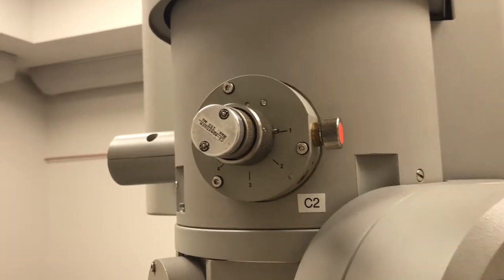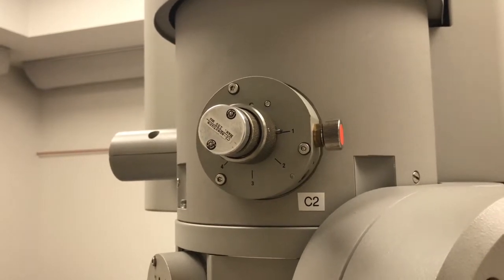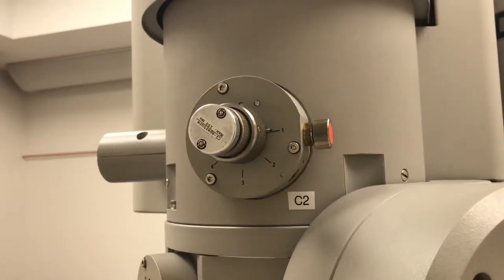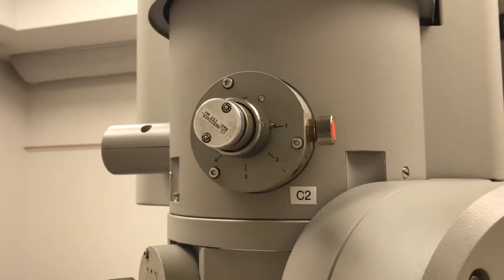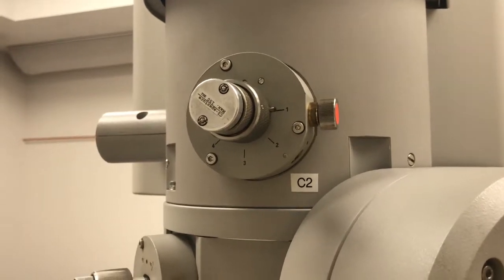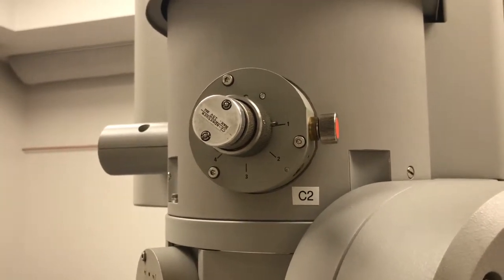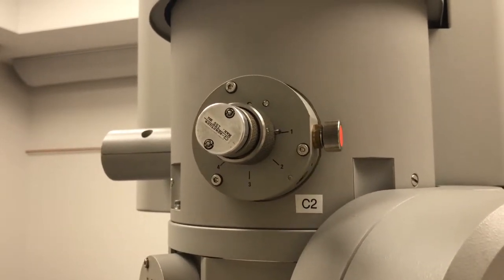I can still get reasonably high current using that aperture without the expense of a larger probe, so I'm leaving it set at one. I could boost it to two if I wanted and get an increase in current, but at the expense of potentially a larger probe. There are always trade-offs: lower numerical spot size gives you higher current but also a bigger probe. Using an optimally-sized C2 aperture will cut current a little; going bigger gives more current but again at the expense of a larger probe.